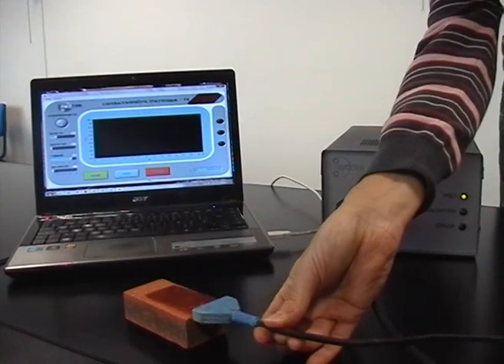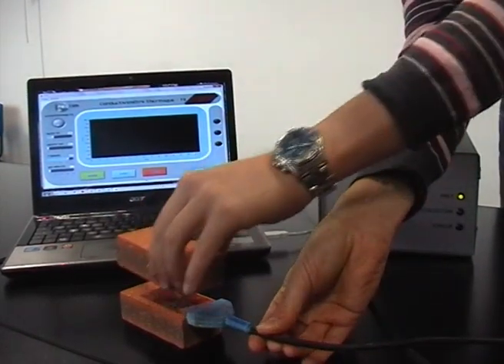To do the measurement, you just have to place a probe between two pieces of material with a good surface.